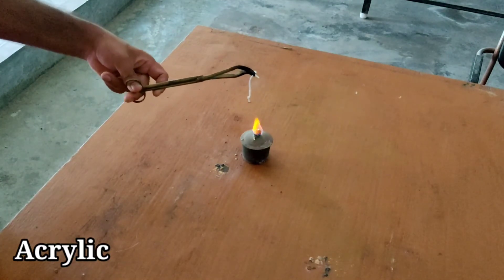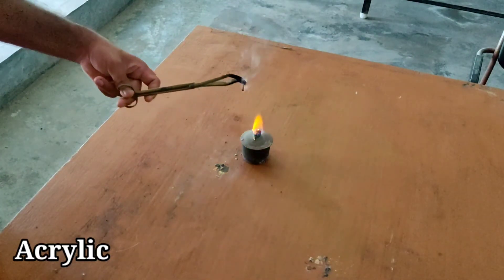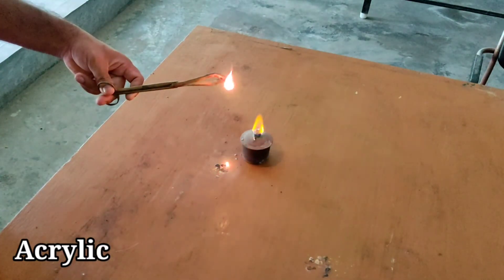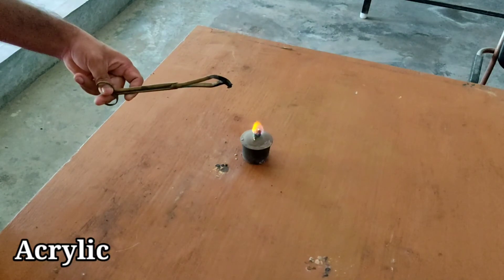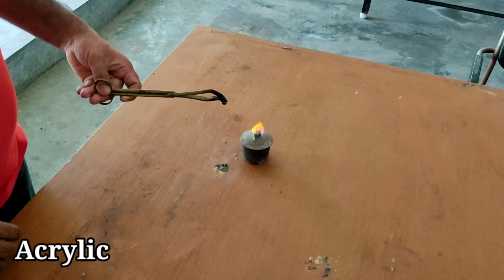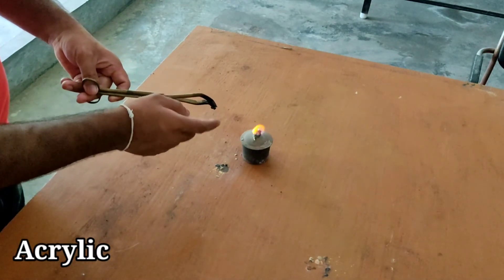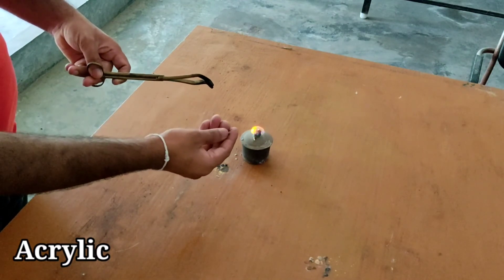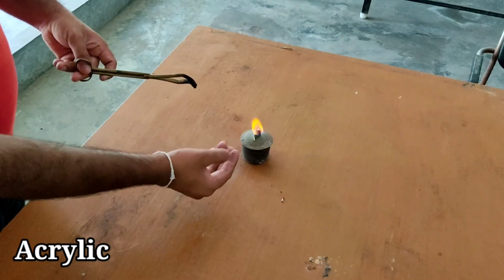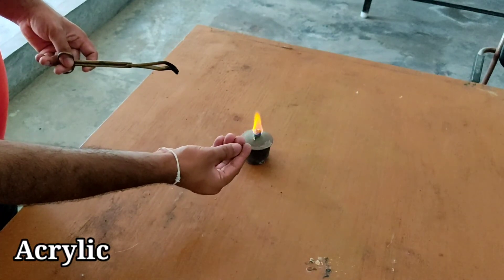Demonstrating with acrylic yarn: it melts and then continuously burns and melts. The odor while burning is just like a chemical smell. The residue is a hard black bead and we can only partially crush it.